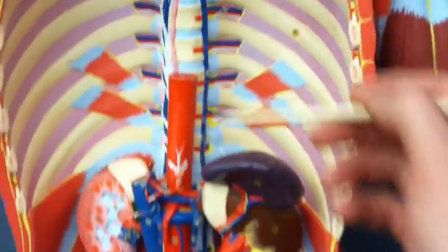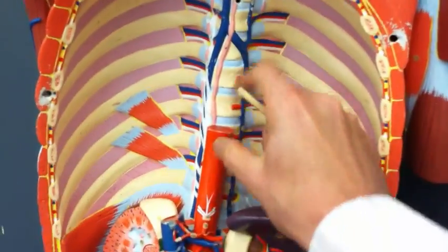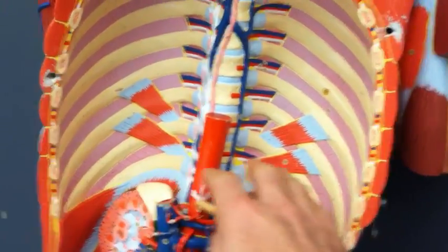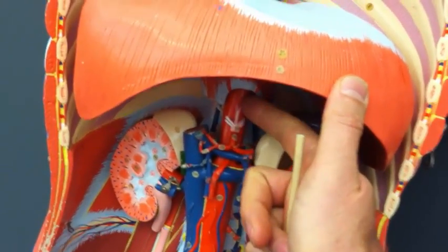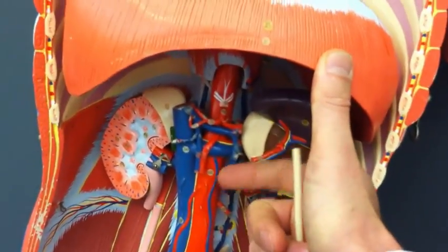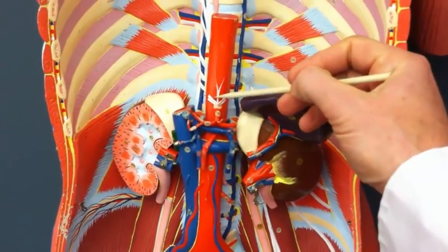Let's keep going south here. Remember, we had thoracic aorta up here. You would have the diaphragm in this neighborhood. In fact, I'll just grab it. This is the diaphragm. It goes right in here. And below the diaphragm, of course, we're in the abdominal cavity, so this would be the abdominal aorta here. I'm going to remove the diaphragm and go back in here. So abdominal aorta.